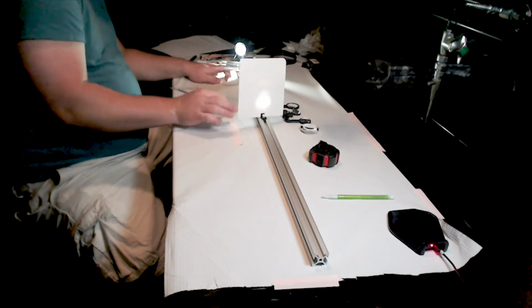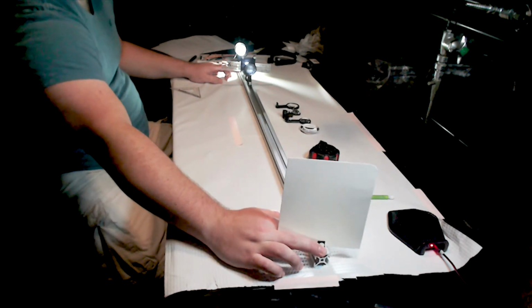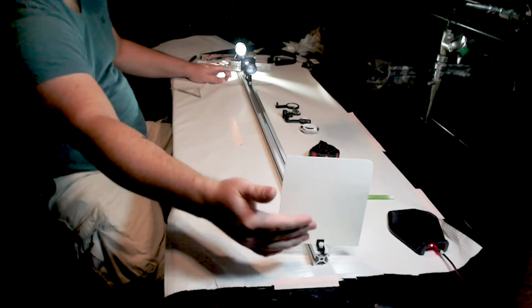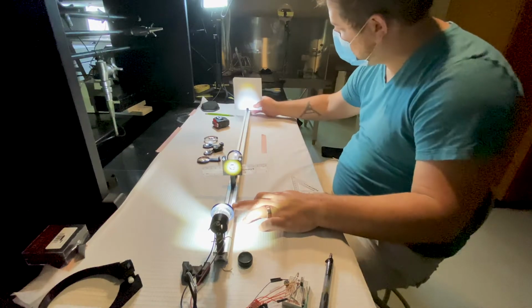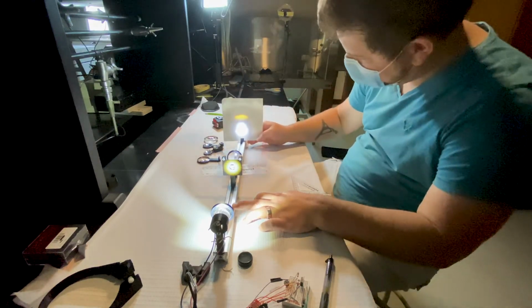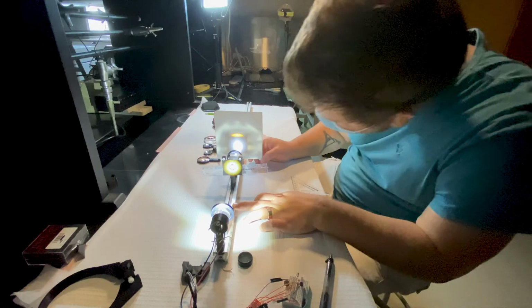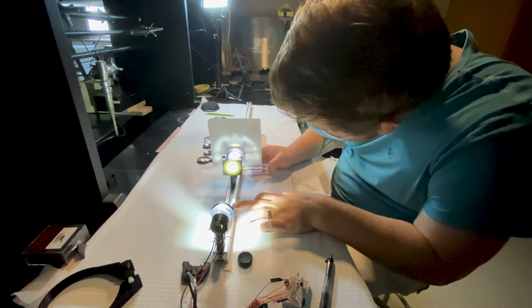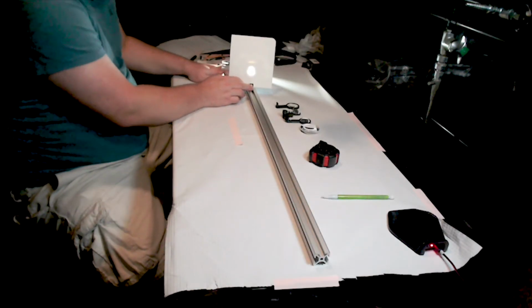So, let's first check a very far distance away. Well, I'm not seeing much of anything. I'm maybe beginning to see formation of the image of the LED, but I'm not seeing much of a ruler. All right, so not really seeing anything there. Let's move it a little bit closer. All right, I'm getting the back focal plane of that lens there, but I'm still not seeing an image of the ruler. I don't know what that looks like to you, but I'm not seeing a ruler there.